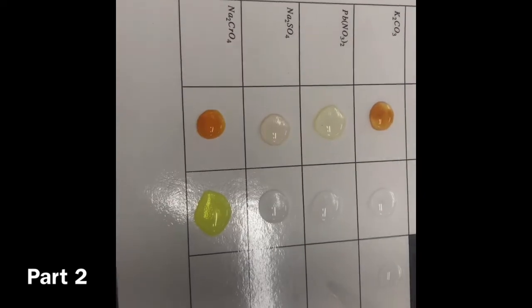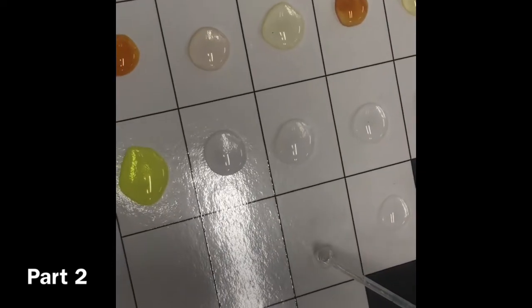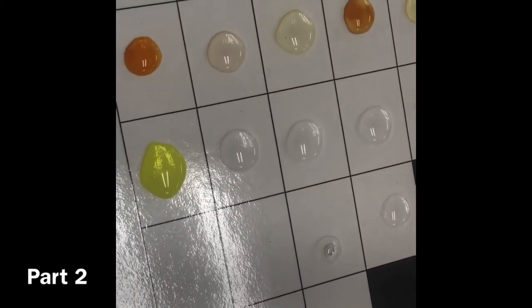So when this particular iron reacts, it's always going to be 3. If it was the iron 2 chloride, then it would always be 2. Does that make sense?